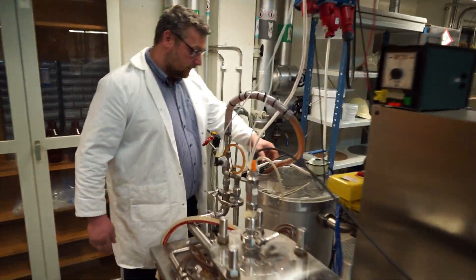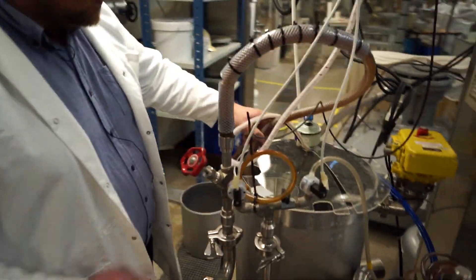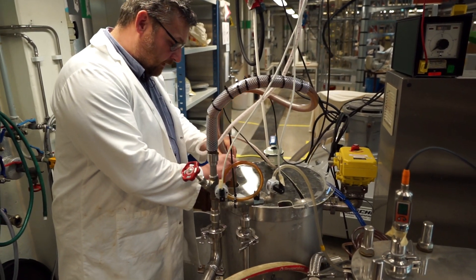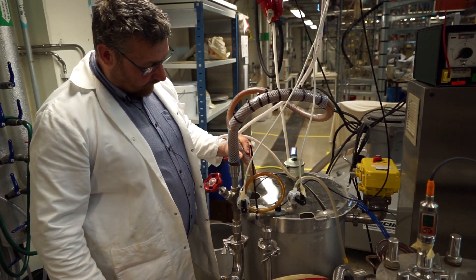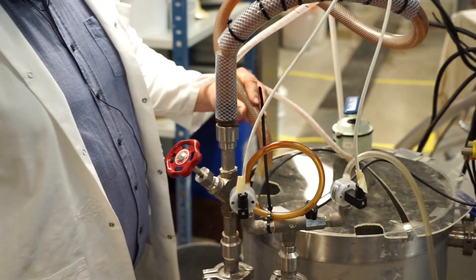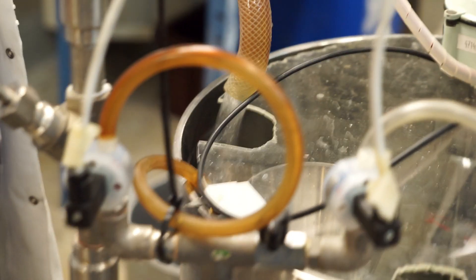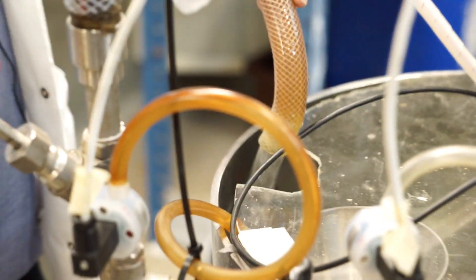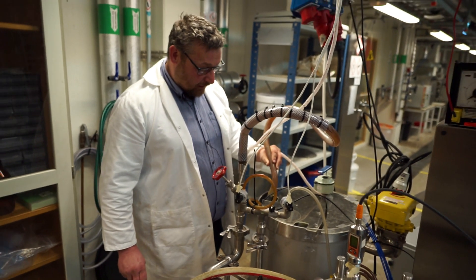I'm hearing a trickling sound. Something is actually happening. So, this is the flow we have at 11 Hz, which is a nice little flow. I'm probably going to stop here, since this is just a demonstration of what it looks like.